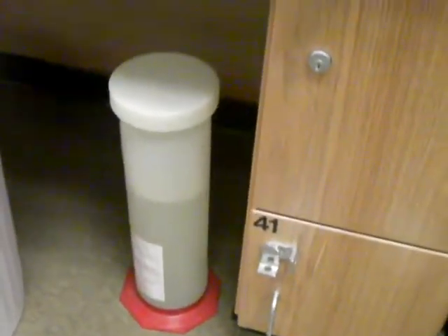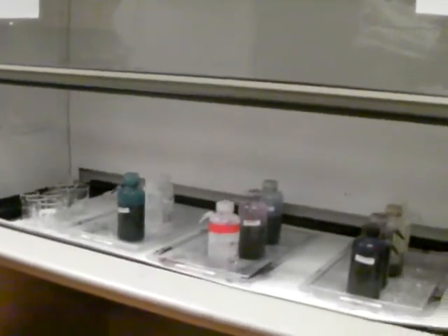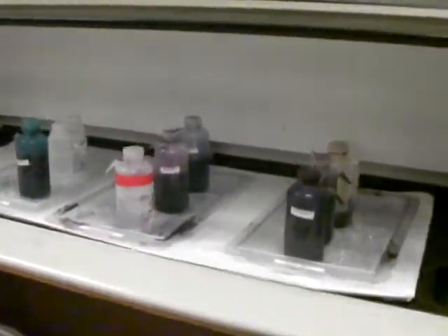These bins here are dedicated for pipettes — big pipettes or small pipettes; I'll show you later where you put them. Here you have the hood, where those bottles are going to be the chemicals you'll be using for your stains. This is the place to refill your little bottles — you're going to have little stain kits for each bench.